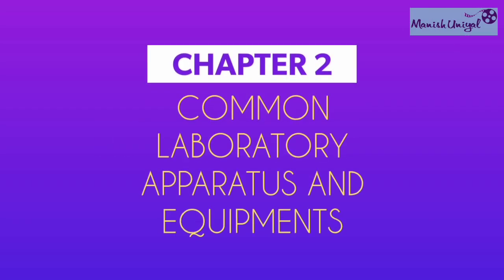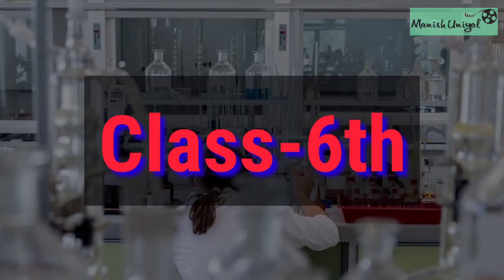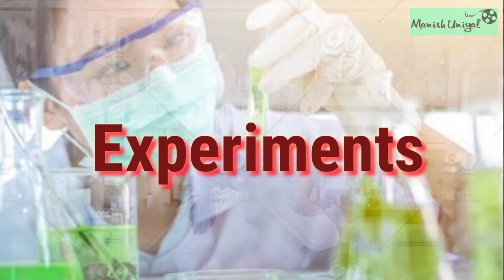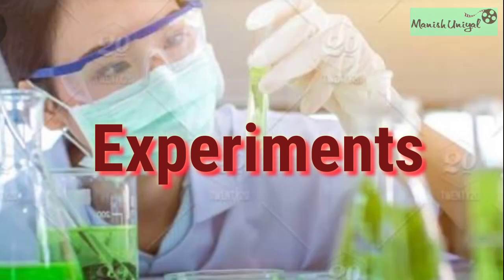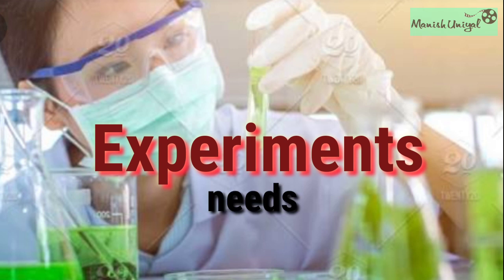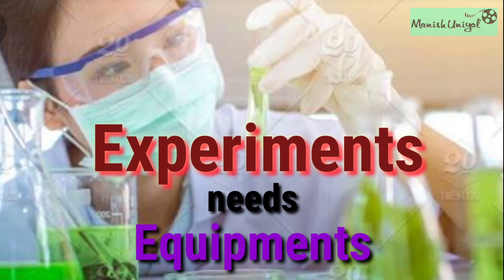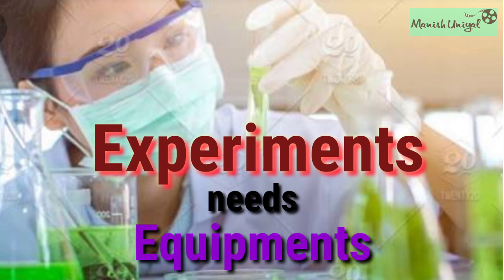Hello everyone. In this video we are going to learn our second chapter of chemistry class 6, that is common laboratory apparatus and equipments. As you know, chemistry is incomplete without experiments. So for doing experiments, we need some equipments. We have to know about what equipments we can use in a laboratory, and in this chapter we will discuss about them only.